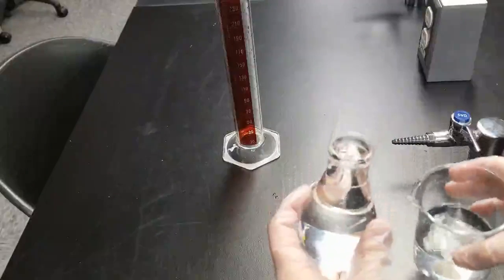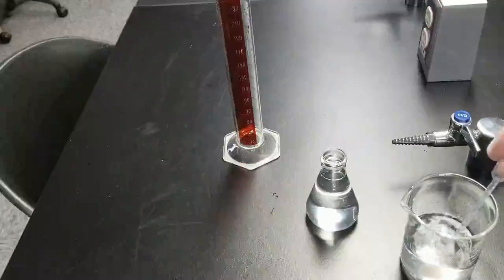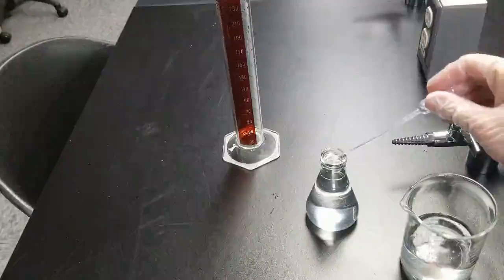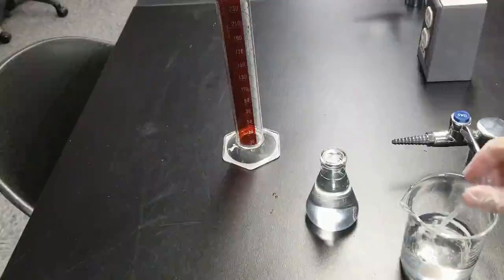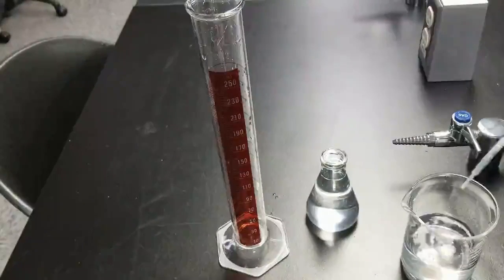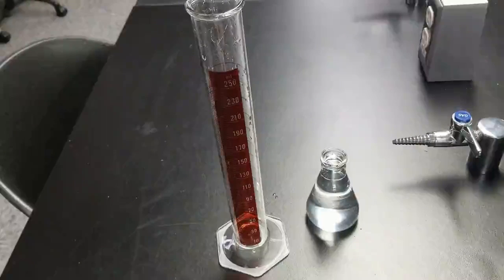Fill it up very close to the brim, as you can see, and then just use this pipette here to top it off a bit. Cool. Looks good about there. I'm going to transfer this water into my graduated cylinder so I can see what the volume of my Erlenmeyer is. Since it's all totally full, I'll use this pipette to just get rid of the top layer. That way I can easily pour after that.